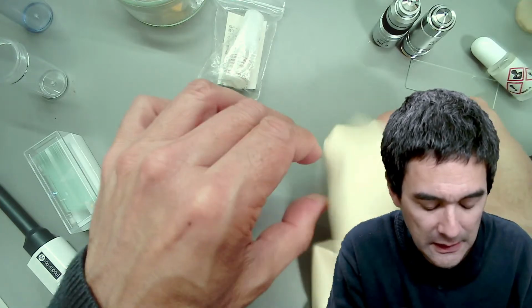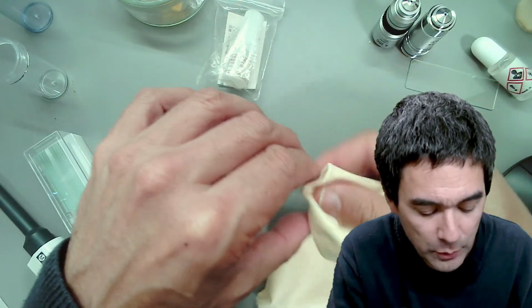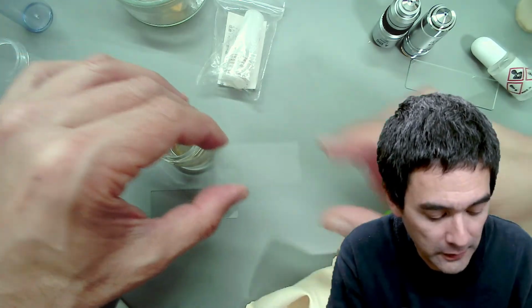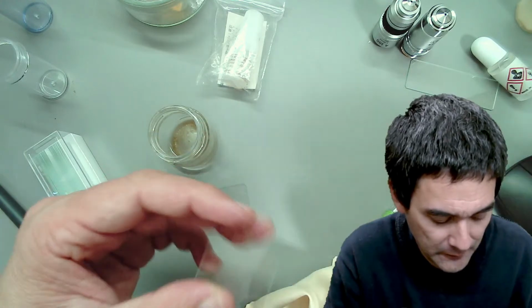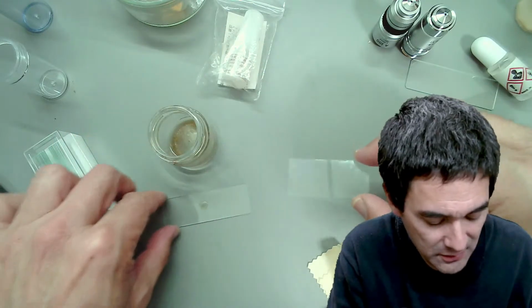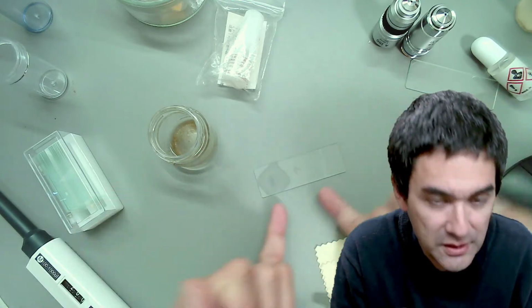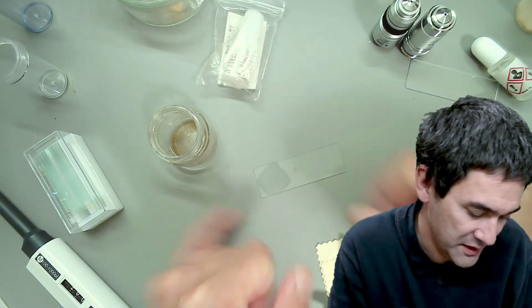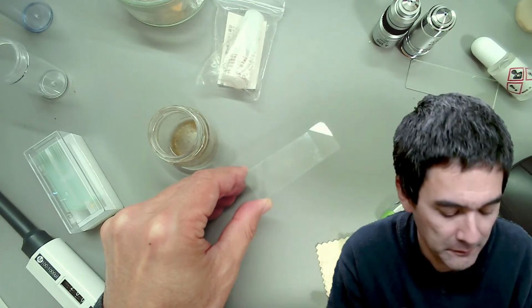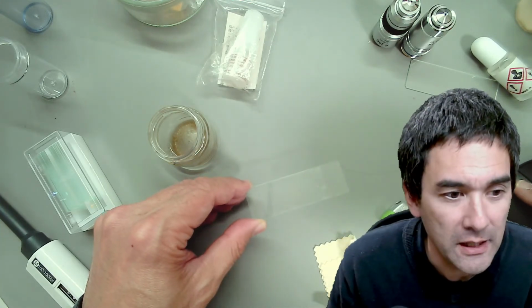If you use a fairly large cover glass, then the liquid will also spread larger, and that means you will get a very thin film, hopefully, of the specimen. So let's try this. Still a few fingerprints on here. It goes on top here, and I don't know if you were able to see this, but it immediately spread and made a very thin layer. Then I just do regular microscopy, and I work myself upwards with the magnification.